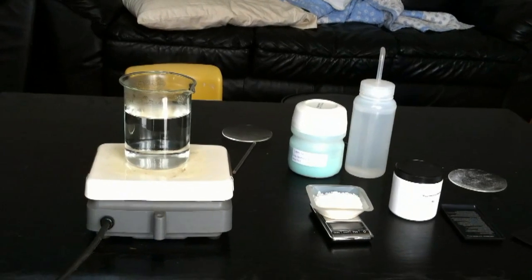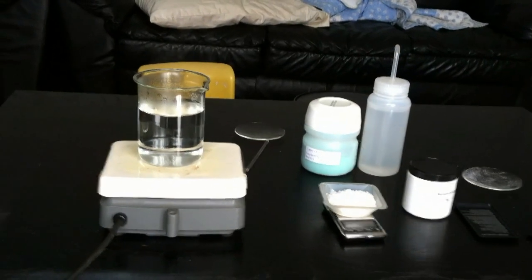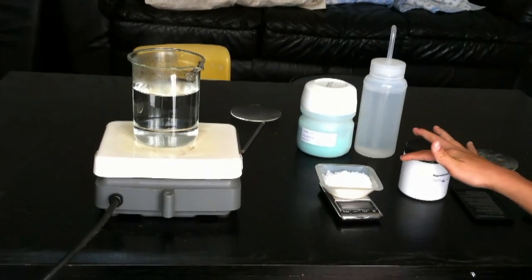First lay out 50 grams of benzoic acid. This is around 50 grams of benzoic acid.